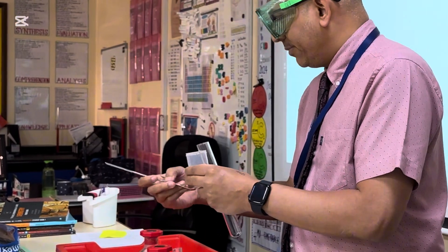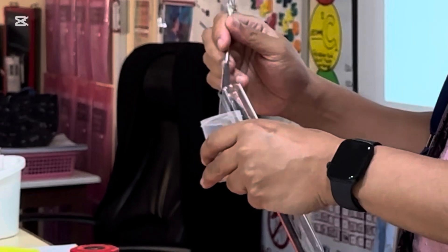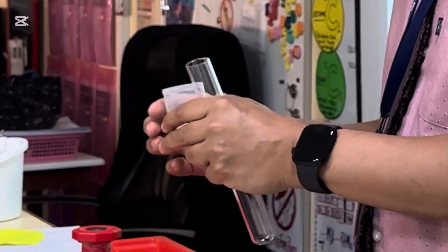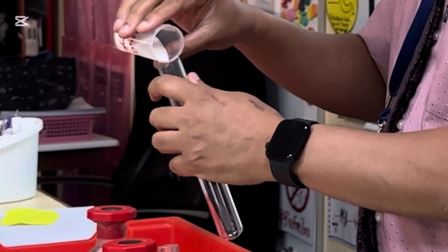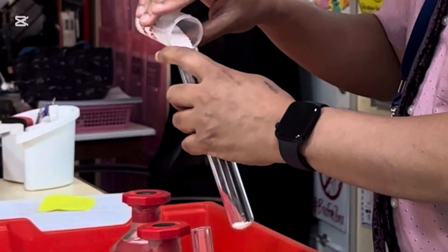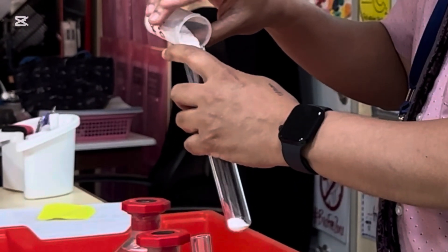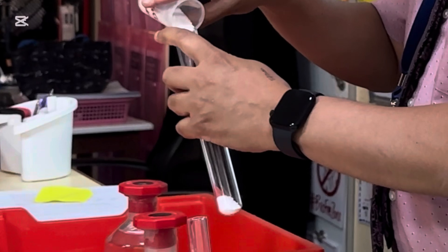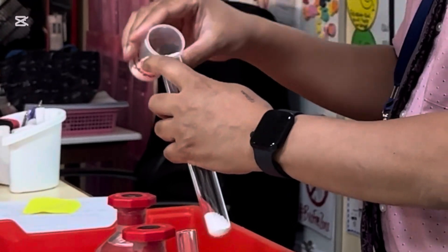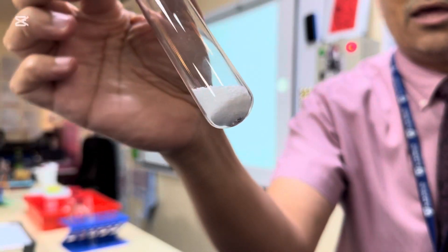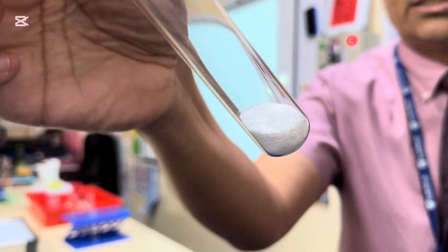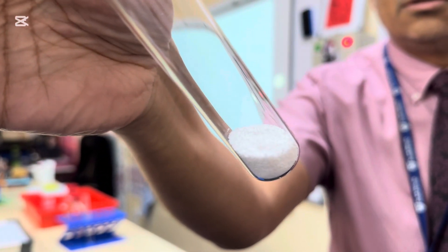This powder is sodium carbonate. Sodium carbonate is actually contained in washing powders. So I've actually got this in a slightly large test tube so I'll bring it close to the camera and show you in greater detail. There we go. Can you see that? Great detail, love it.